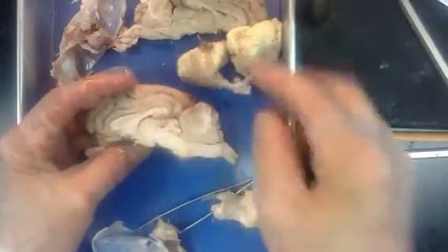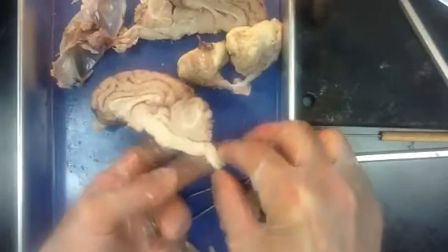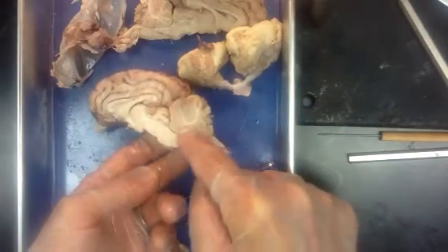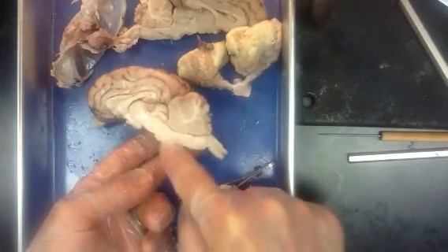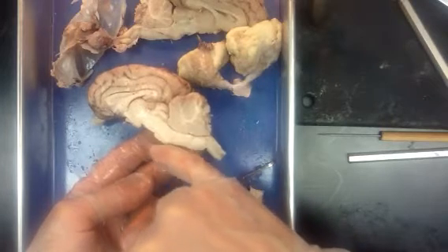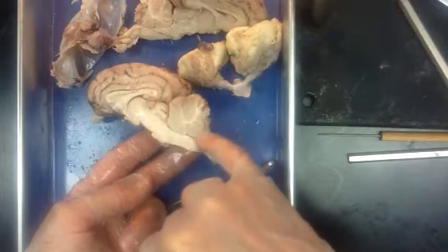Okay. When we look at this lateral view, sagittal view, we see the medulla is kind of this widened place of the spinal cord. Then right across, the next major structure up, we see the pons, which is a little bit larger in the human. It's just a small oval here. And then the cerebellum is directly across from that.